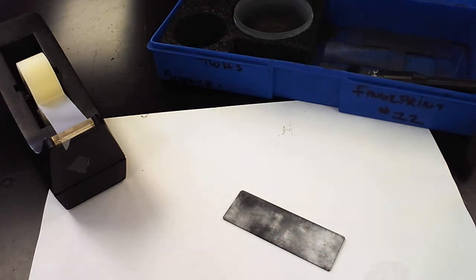So you want to pay close attention and you are welcome to practice this station a couple of times. I wouldn't necessarily do it one or even two times. I would go for three or four times practicing this.